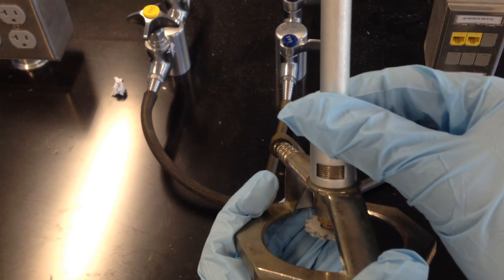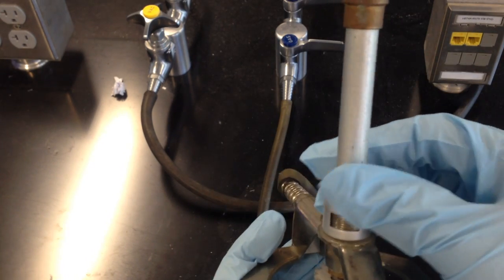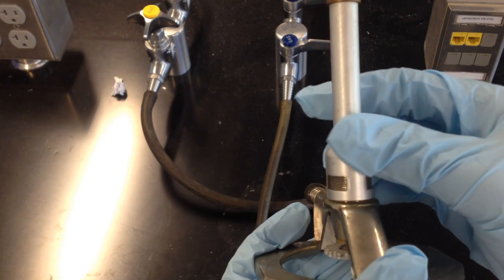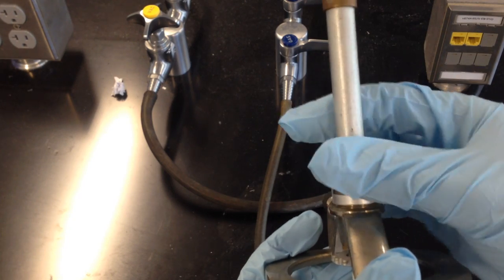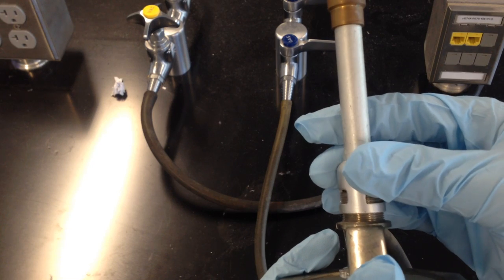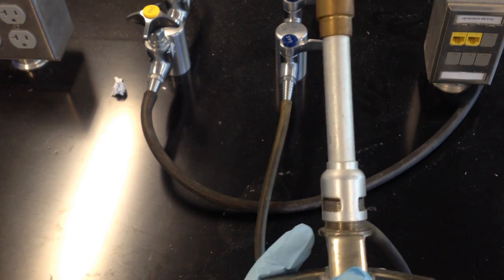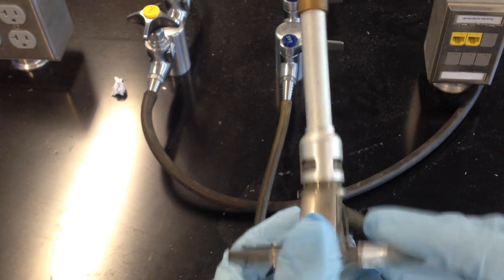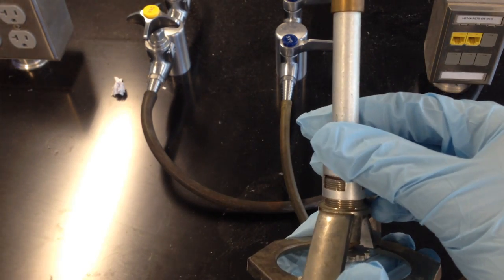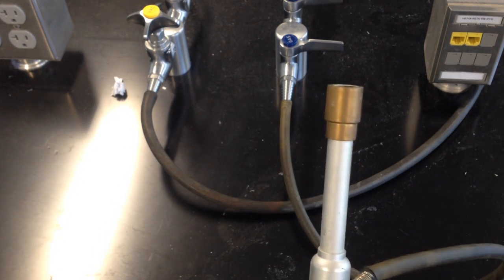The valve at the top controls the amount of oxygen that ends up in the final flame mixture, and we want this about halfway up. So we'll unscrew this until we get the lighter metal part about halfway up the threading. About there looks pretty good. At this point, with a full turn on the bottom and halfway up on this upper valve, we're ready to light the Bunsen burner.